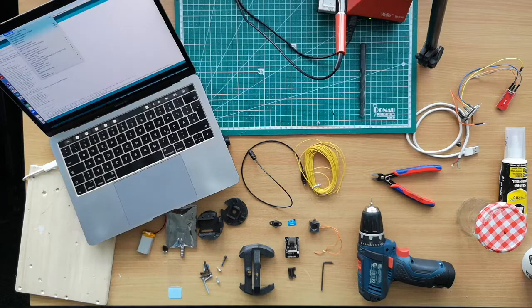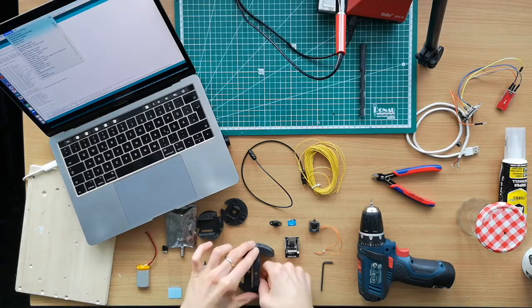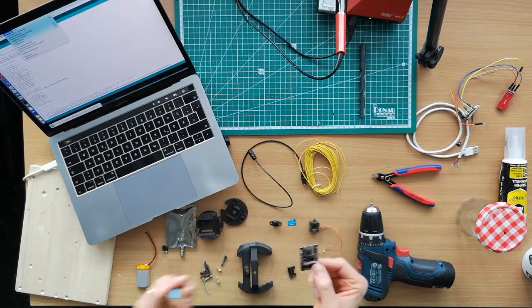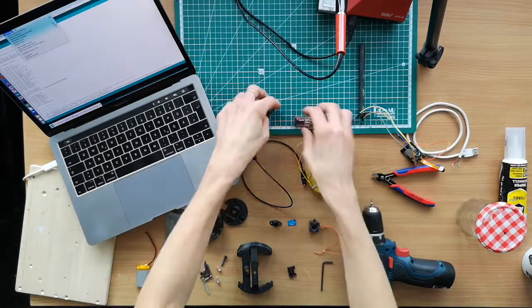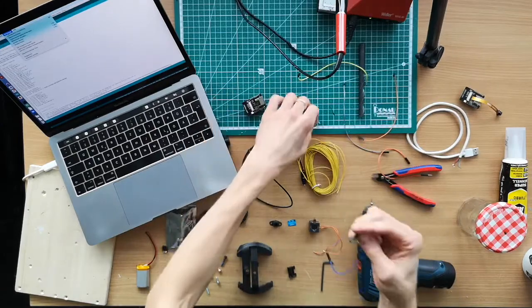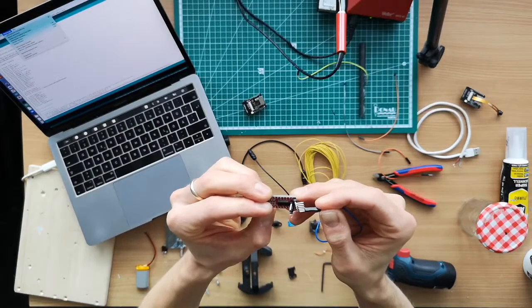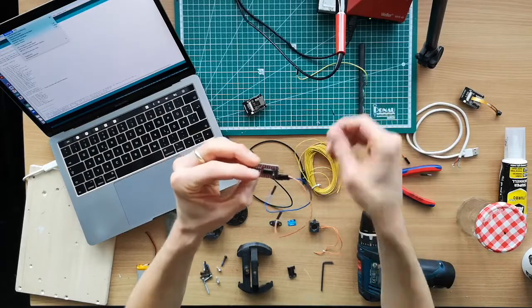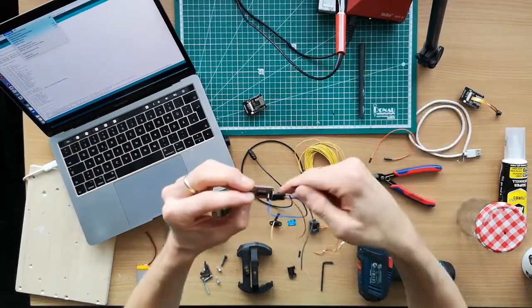So we won't tell you all the details how to flash it right now in the video. There are some more descriptions in the online documentation, however. So we have the camera module, the AI Thinker, and you also need to have this flashing tool. This just connects the USB to the UART, and you have to wire the whole thing up. There are a bunch of tutorials how to do that. I'll just briefly explain. They have 5-volt, ground, receive and transmit. So you have to use those two lanes here and there, and then also the power. And don't mix up the power, of course, because otherwise you will burn the ESP.